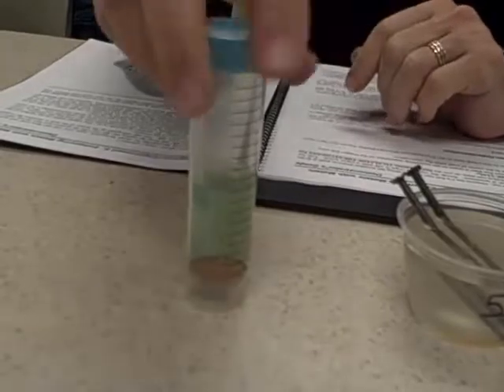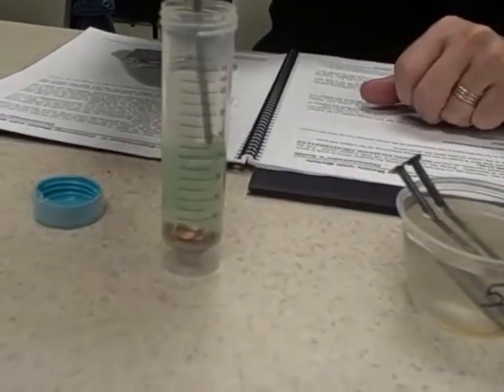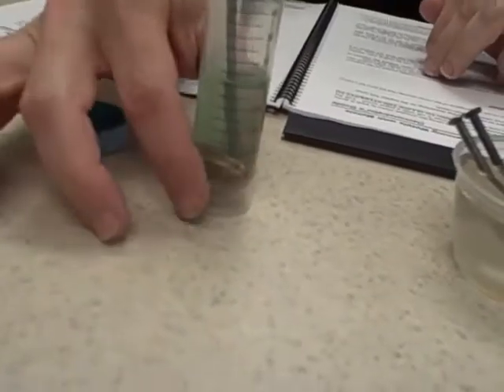Once it's all mixed up, well and good, take the nail at your place and gently slide the nail into the vial. You can leave the cap off at this point and we'll see what happens. Okay. Those were parts 1 and 2 of this experiment where we're coating one metal with another. Now we're going to come back to that in just a second.